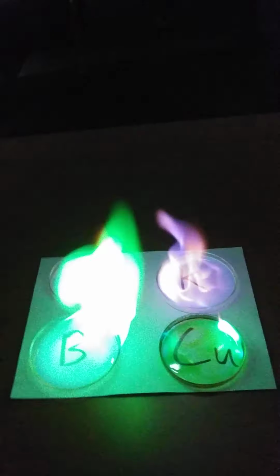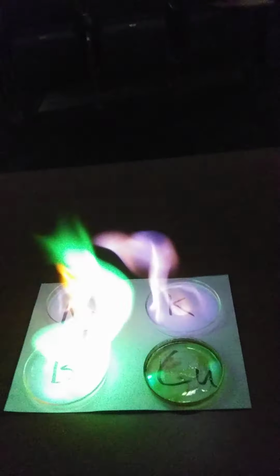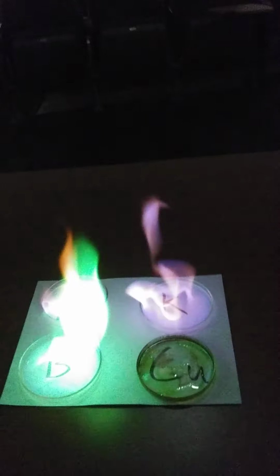Anyway, so we have instruments. This is just with your eye identifying the different colors. Maybe you can see a little bit of the purple in the potassium now. But we have instruments that can identify exactly what wavelength of light that is. And in fact, there are instruments where you can inject a whole bunch of metals and identify all the metals all at once based on the color of light. It looks like copper burnt out now.